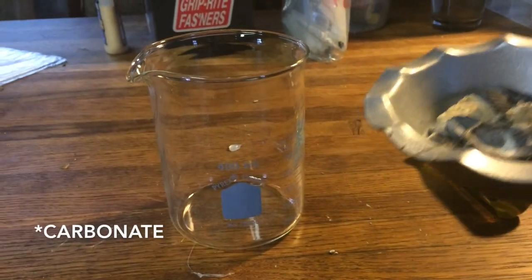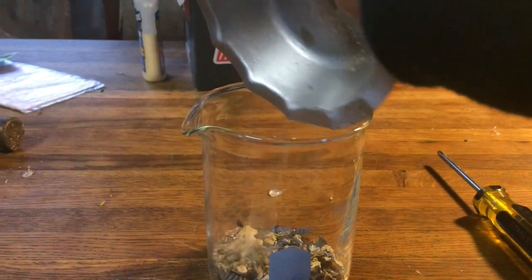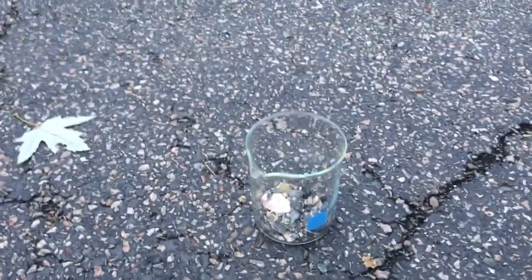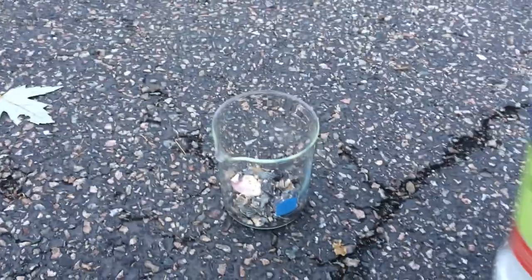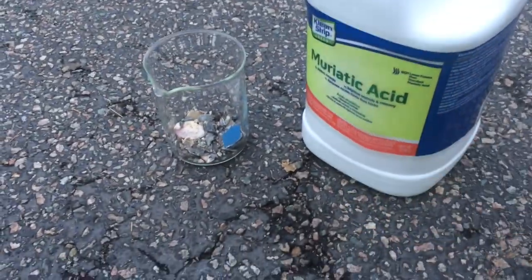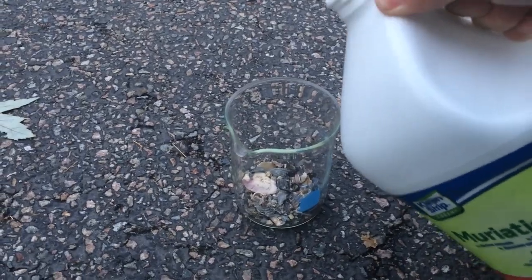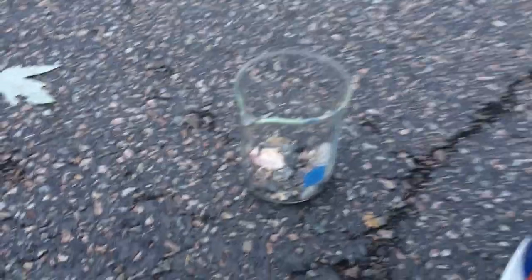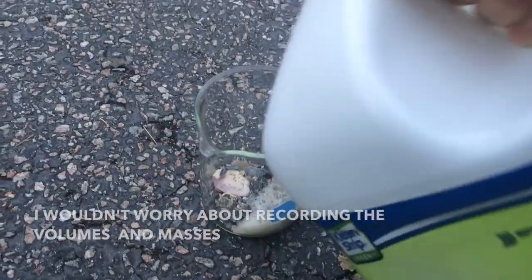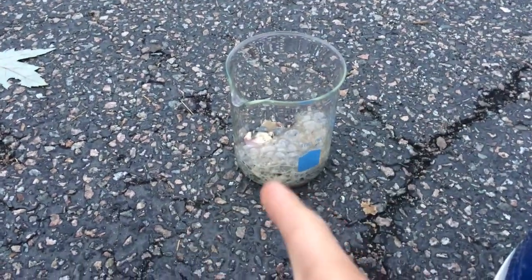Now that I have the calcium carbonate crushed up, I'm just gonna toss it into this beaker. This next step I'm doing over pavement, just in case I spill any of this acid, because this is hydrochloric acid, also known as muriatic. I'm gonna pour it in slowly, because this reaction is gonna produce carbon dioxide and water.